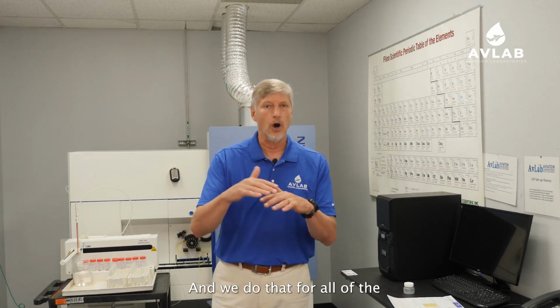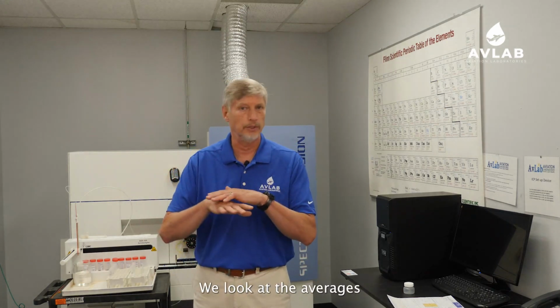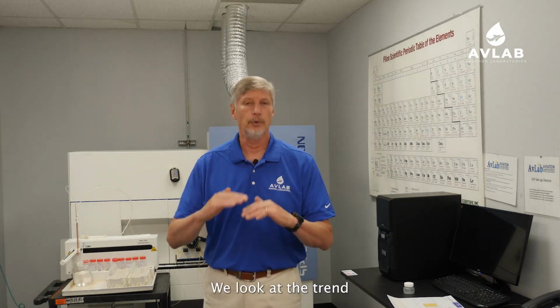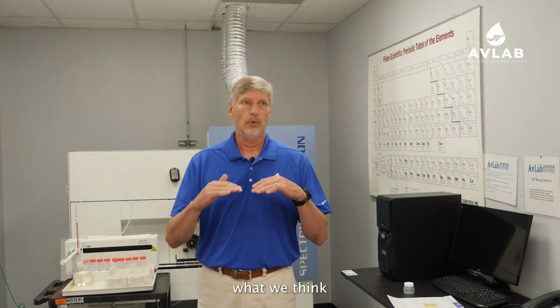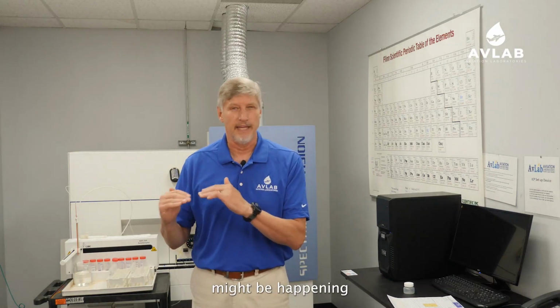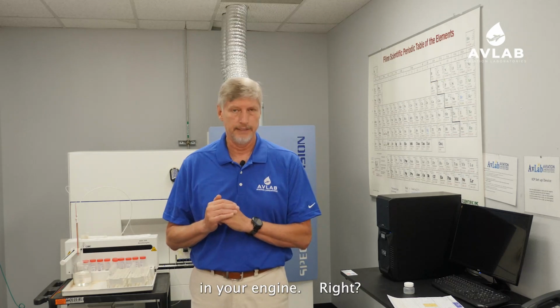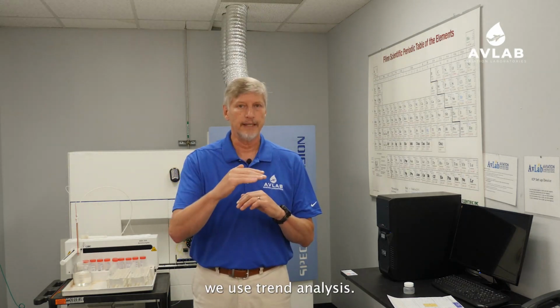And we do that for all of the metals that we've tested for. We look at all of them. We look at the averages of all of them. We look at the trend of all of them. And we comment on what we think is happening in your engine and where that thing might be happening in your engine. Right? So we use comparative statistics, we use trend analysis.